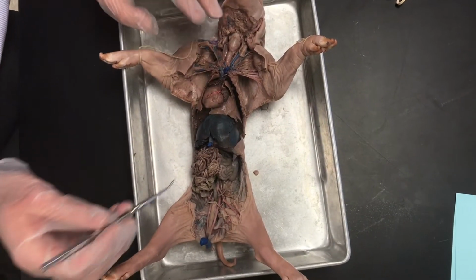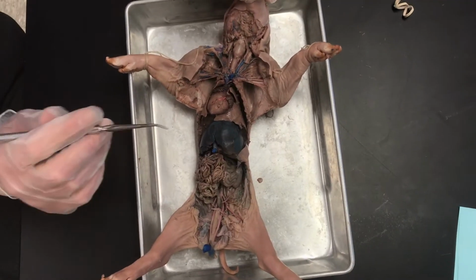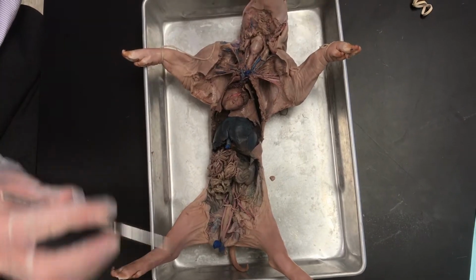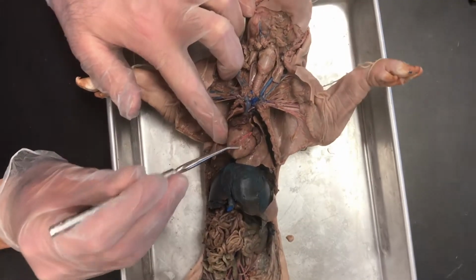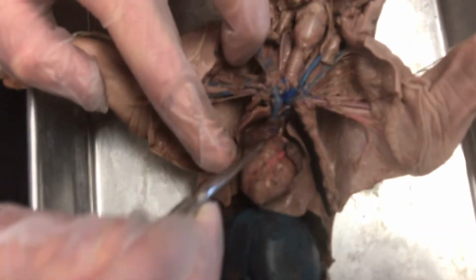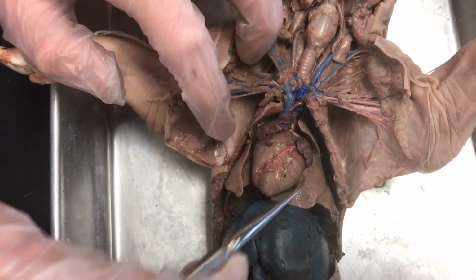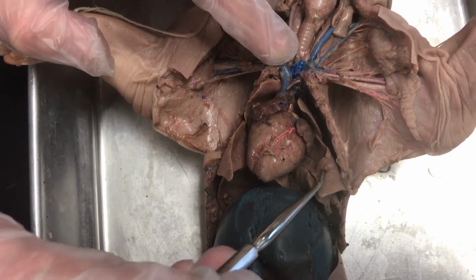Okay, so we are going to review the fetal pig anatomy with this video. First thing, I'll just point out some of the more obvious structures when you first look at the pig. Right here we have the heart, and of course, just like we've learned before, there's the left atrium up here, the right atrium, the left ventricle, and the right ventricle. Surrounding the heart, we have the lungs right here and here.